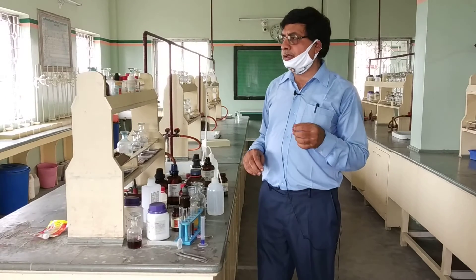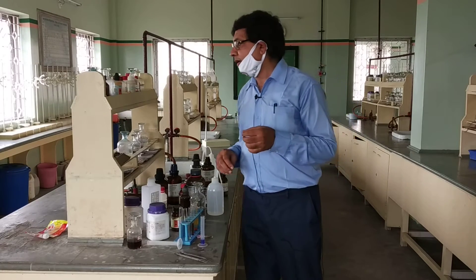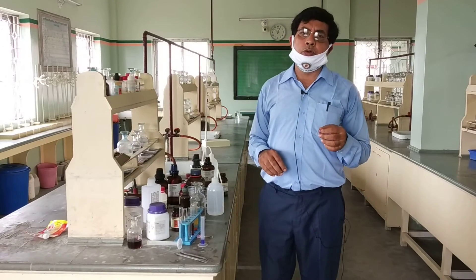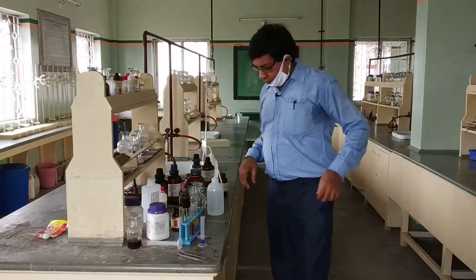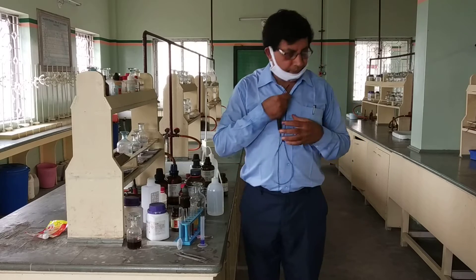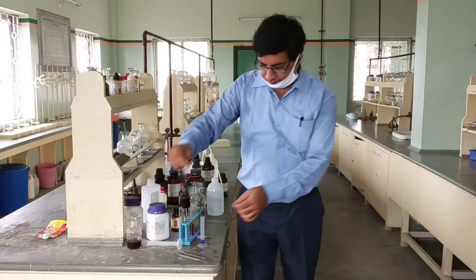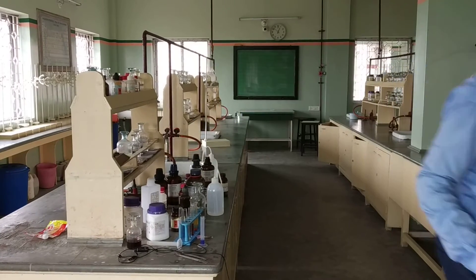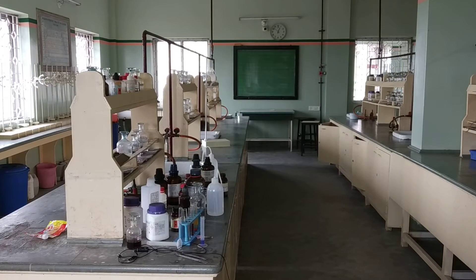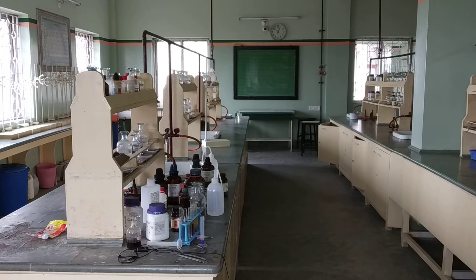If you take sodium bicarbonate solution, then carboxylic acid gives effervescence with sodium bicarbonate. You can also use potassium bicarbonate. Take the acid and observe.